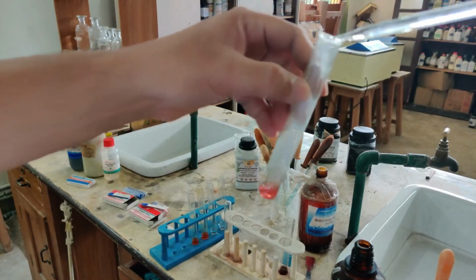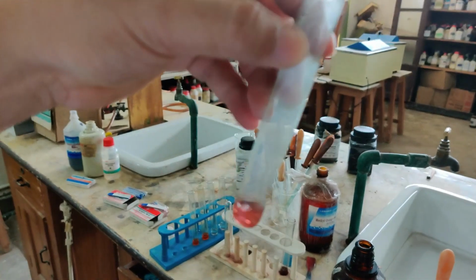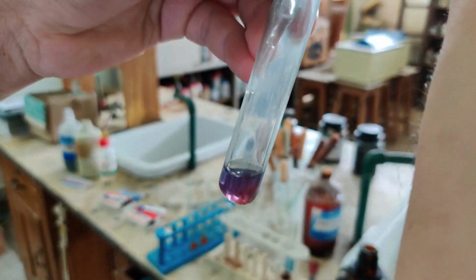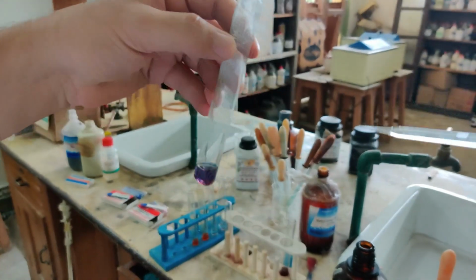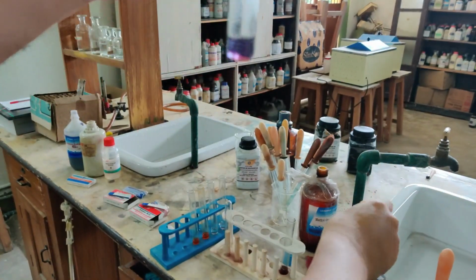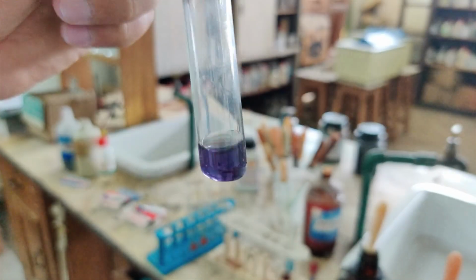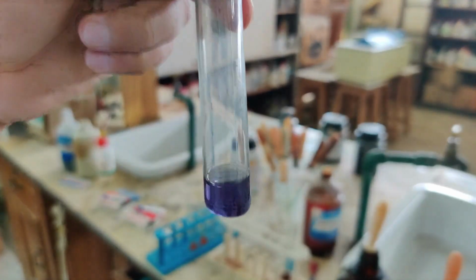Now see the color change that will be noticed there. See very carefully now. There I am adding. So now just a few drops, 2-3 drops is what I have added. So just by addition of the 2-3 drops only, now see how the color changes. And if I shake it, now the whole solution is turning to blue.